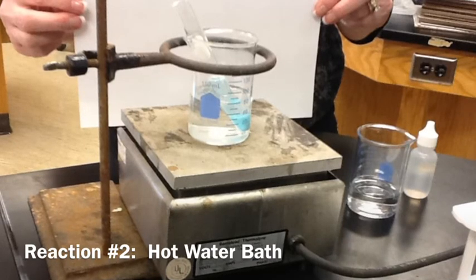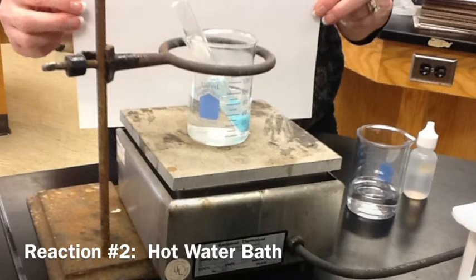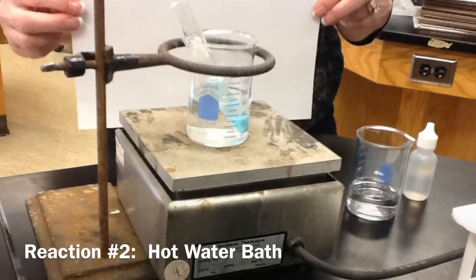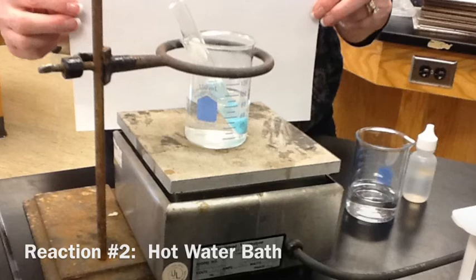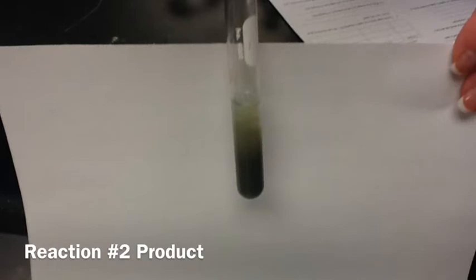An important step here is to make sure that all of the copper 2 hydroxide decomposes to form copper 2 oxide. The copper 2 oxide is a black solid, so you need to make sure that all of the blue solid in the test tube turns to that dark brownish black color.